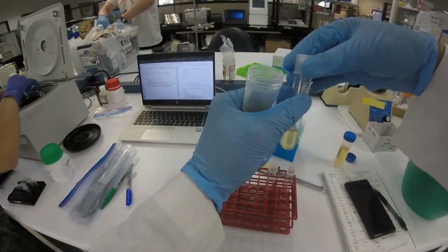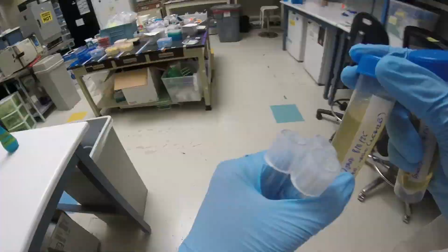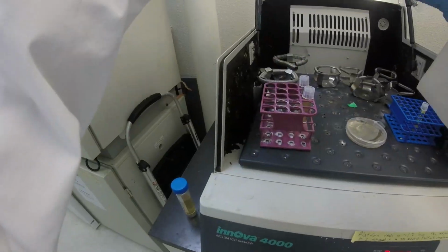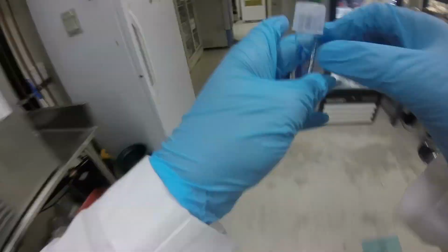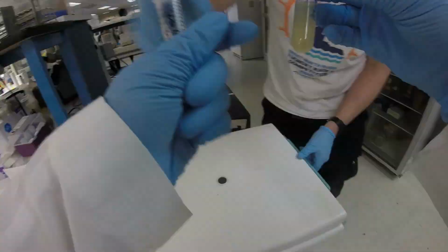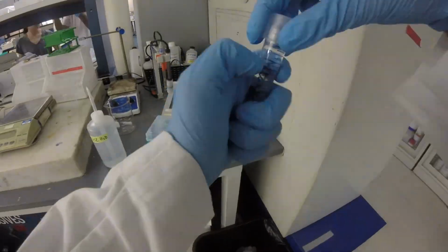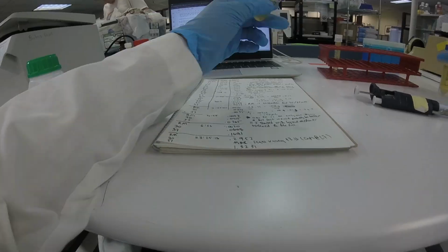Those cuvettes are made of polystyrene, and I knew from the past that acetone works really well to get rid of Sharpie marks, but I didn't know that acetone dissolves polystyrene. So I was like, oh man, I'm gonna be a good person and reuse these cuvettes because they're like $1 a piece, and it seems so wasteful to throw them away. And then they just melted and I had to throw them away. So that wasn't very good. But next time I'll just use 91% isopropyl or something.